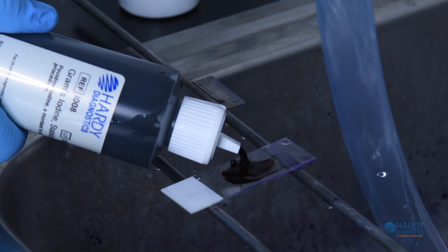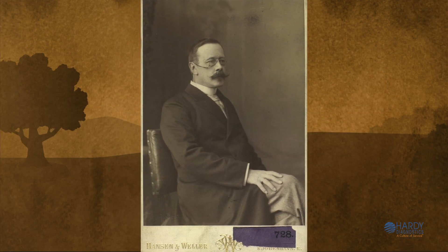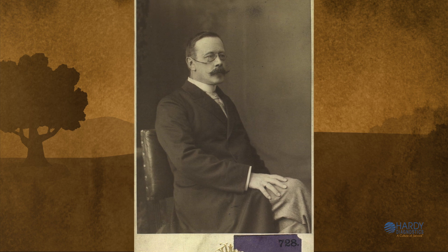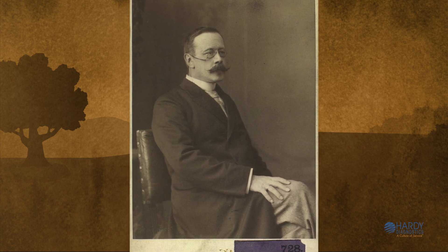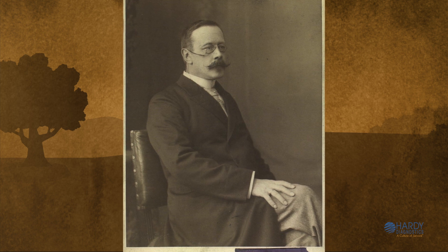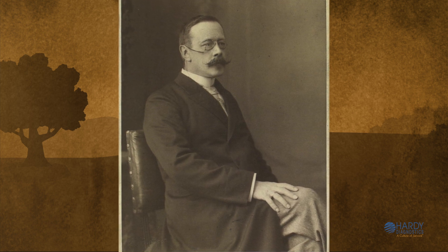The Gram stain is named after its inventor, Hans Christian Gram. As a Danish botanist and teacher of pharmacology, he devised this important method of differentiating bacteria in 1884, and it is still in common usage today.